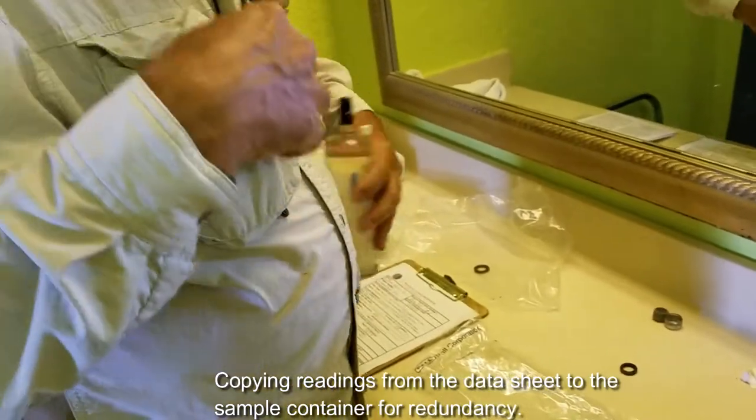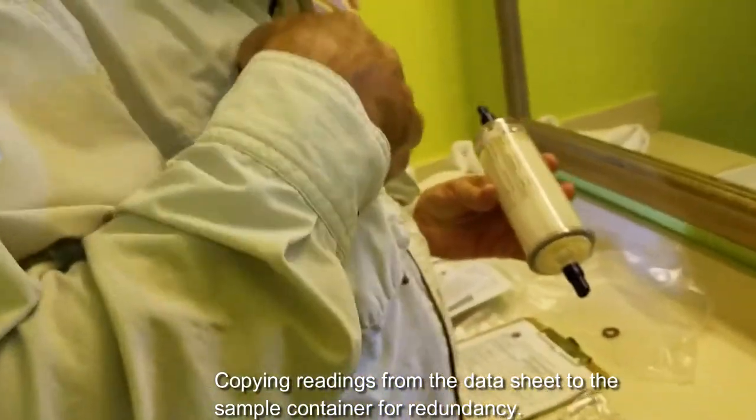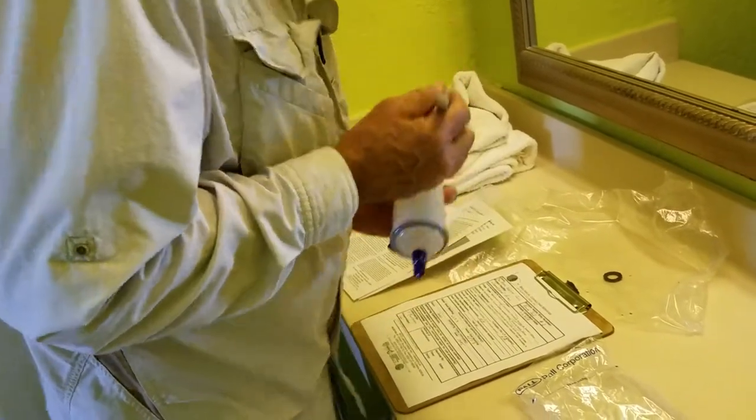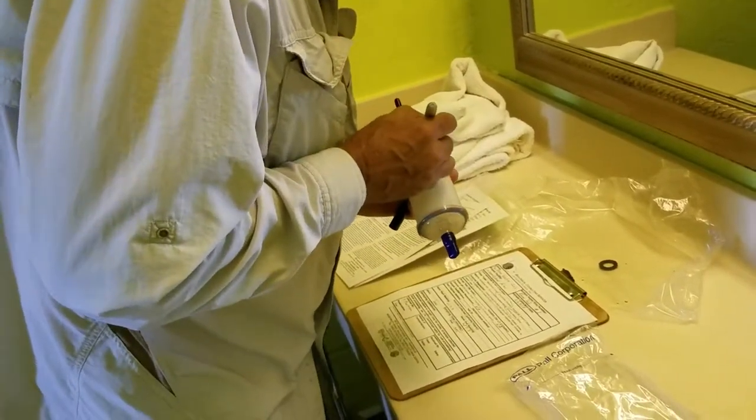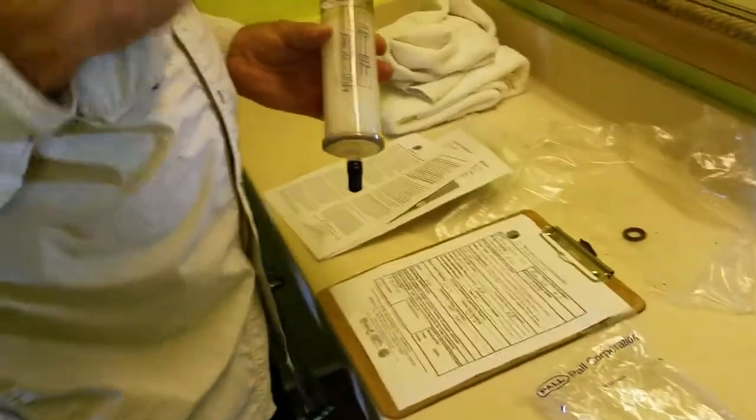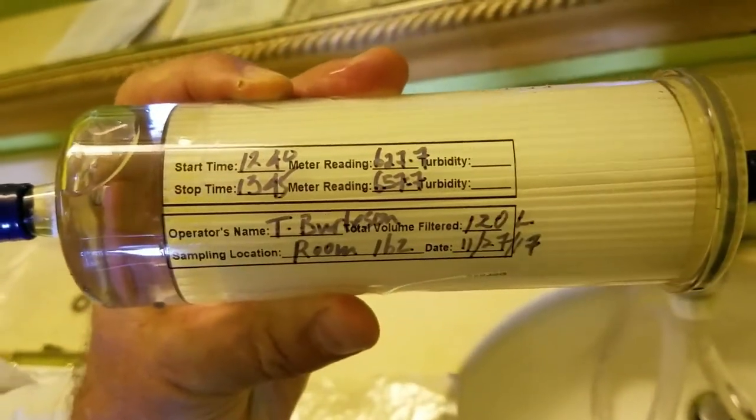And now we'll mark on this. I see, so you're noting the start and stop on the meter as well as the time. Okay.